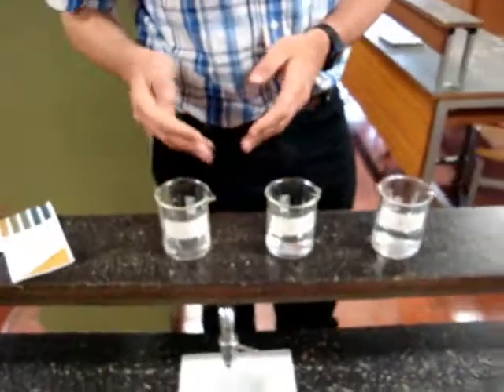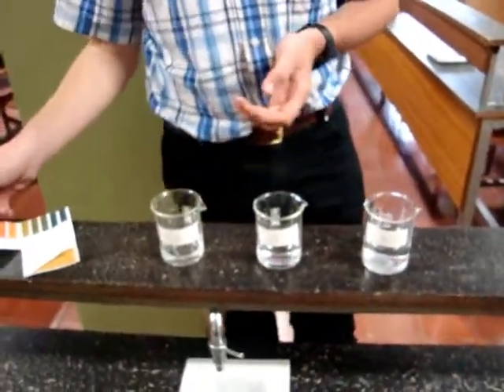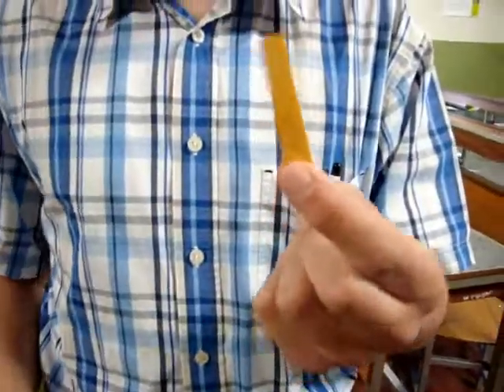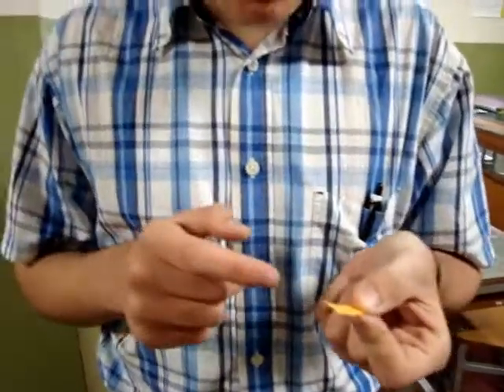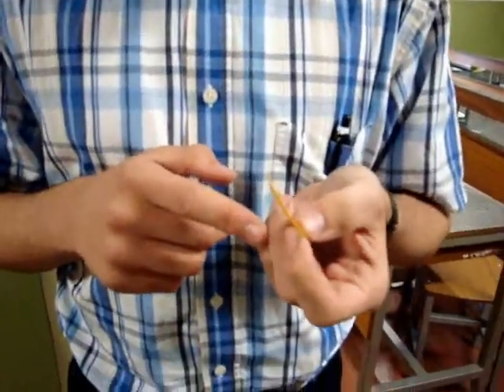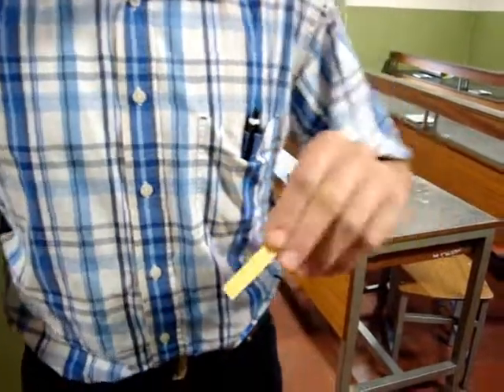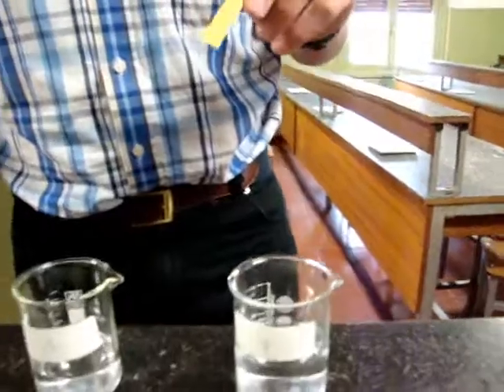Now we are going to determine whether these substances are acid or basic, using the stripes — this is a universal pH indicator. These are covered with a substance that changes its color in the presence of an acid or a base, so we can determine if a substance is basic or acid.